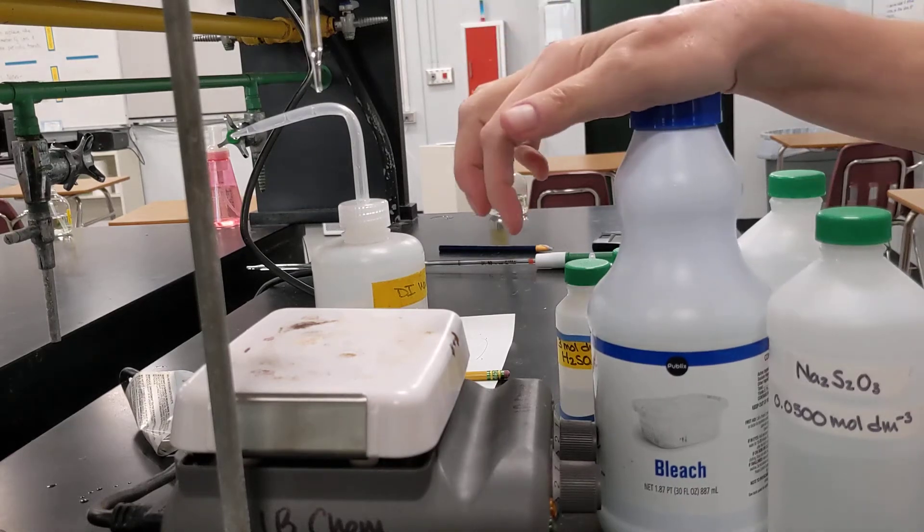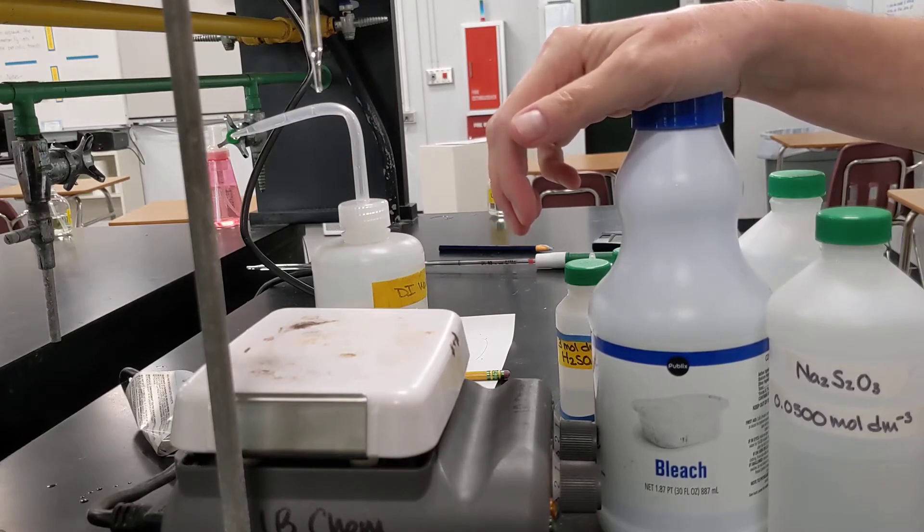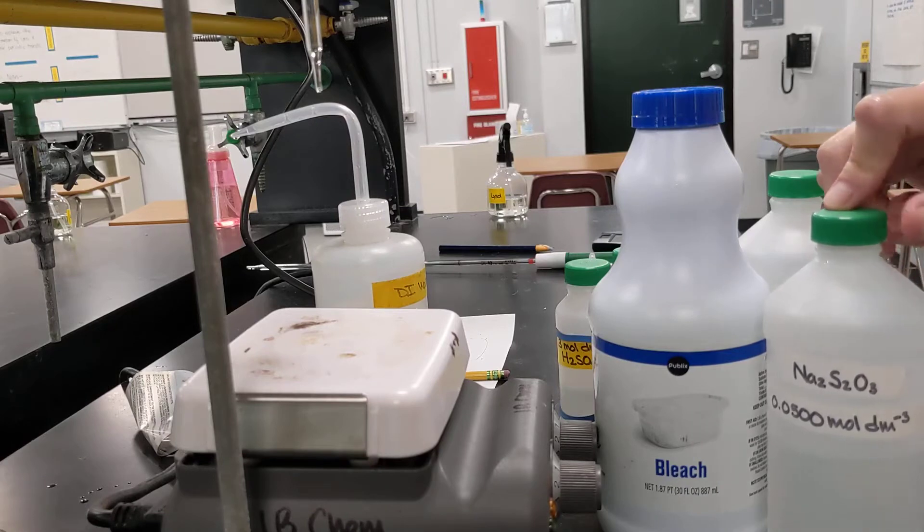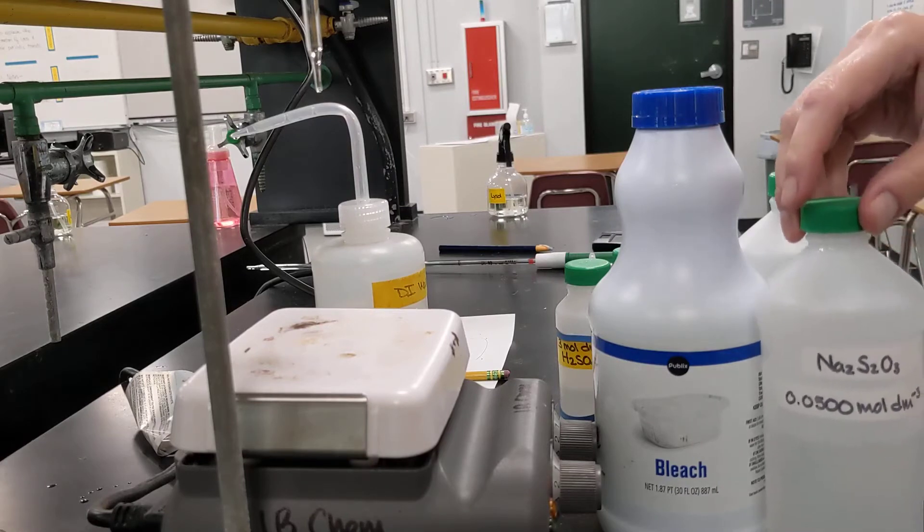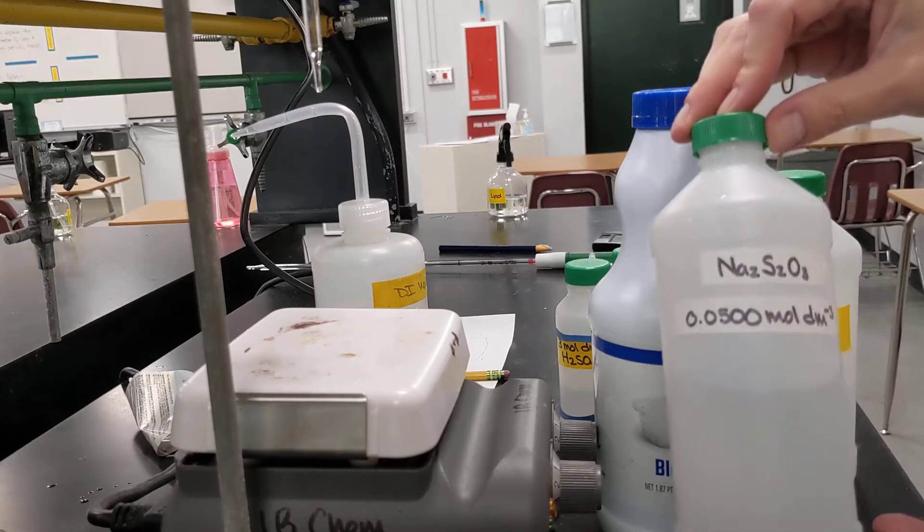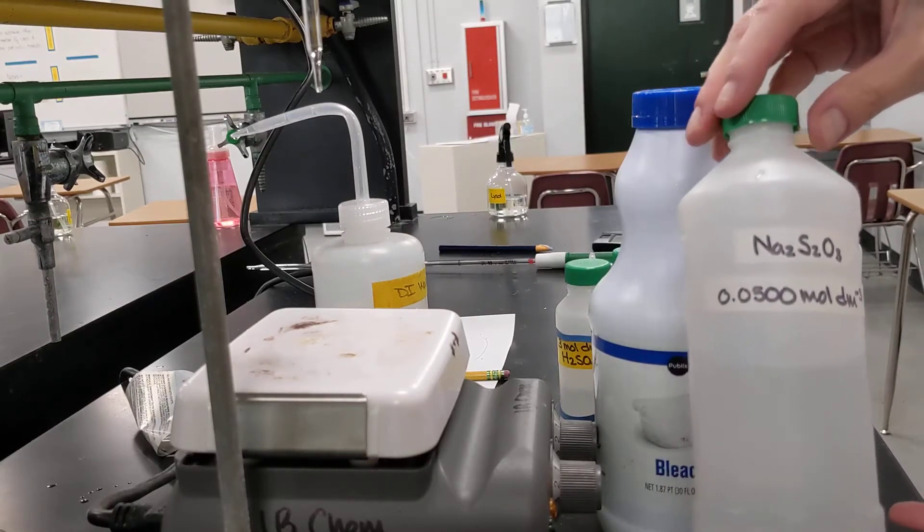All right, let's collect data for our redox titration, the analysis of bleach lab. So before we began, I did a couple of things. The first thing is I loaded my burette with our sodium thiosulfate solution. So that's 0.0500 molar sodium thiosulfate.